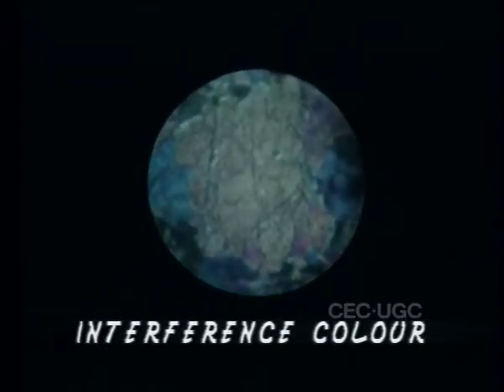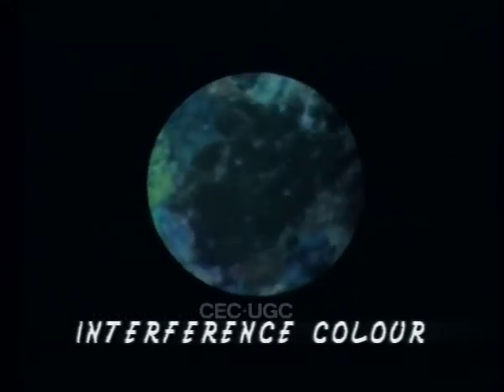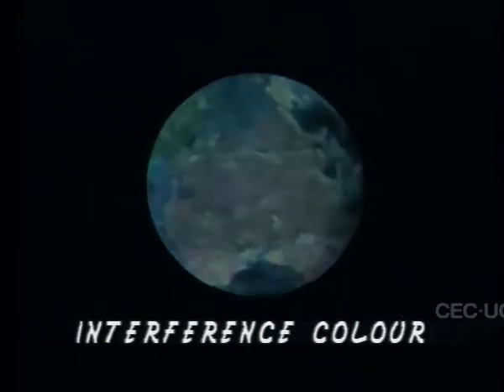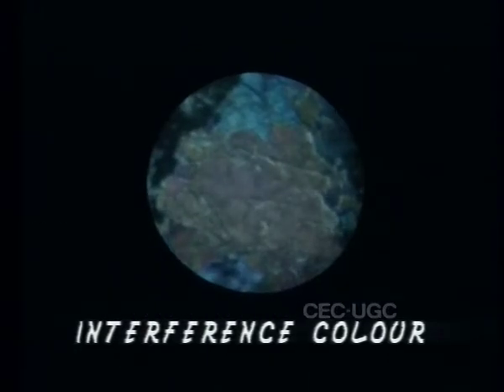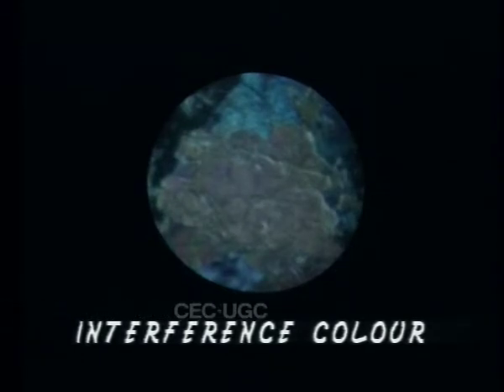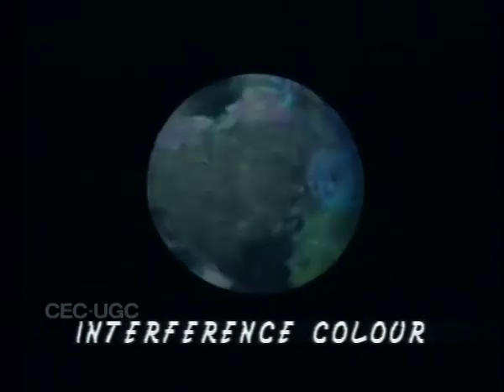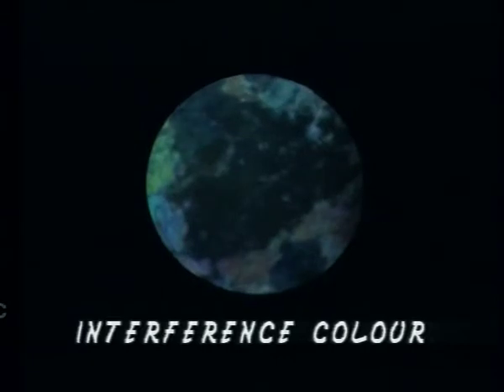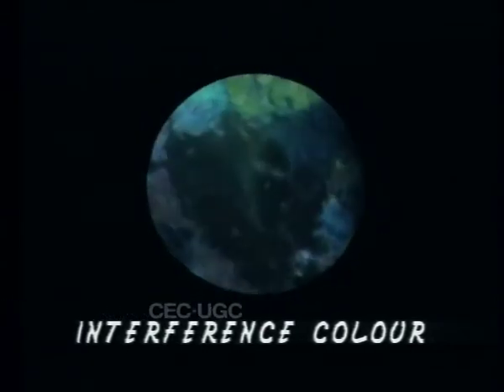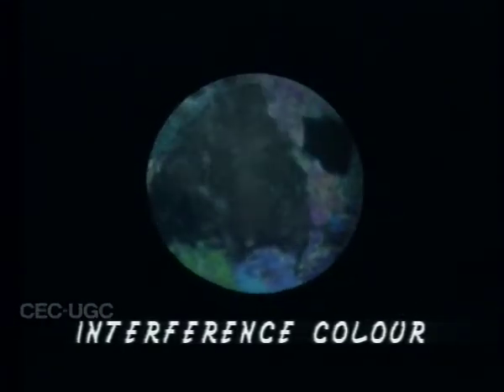During rotation of the stage, the mineral grain assumes darkness at every 90 degree interval. These are called extinction positions. In other positions, the mineral shows a distinct color. The intensity of this color is maximum at 45 degrees from extinction position. This color is the result of interference of light rays having definite phase difference, where the phase difference is set by and is proportional to the birefringence of the mineral. It is therefore called interference color.